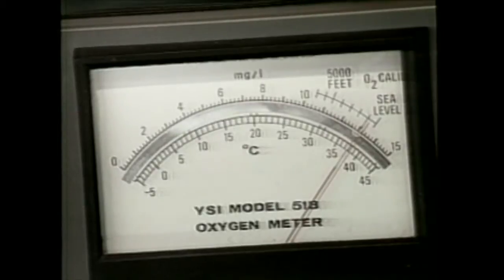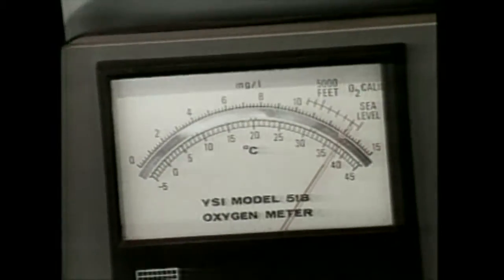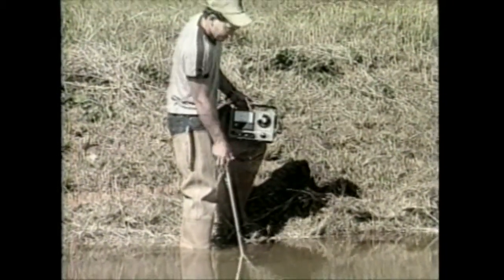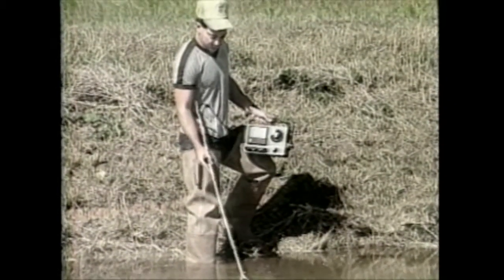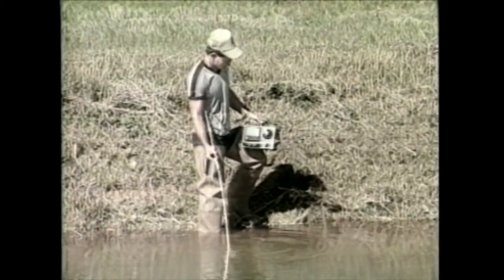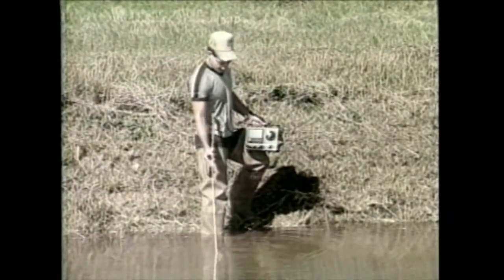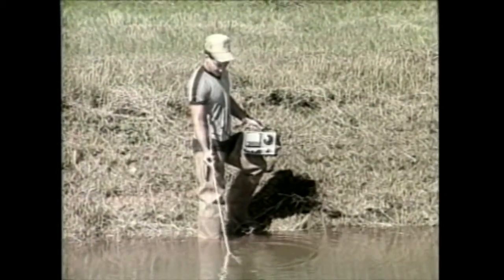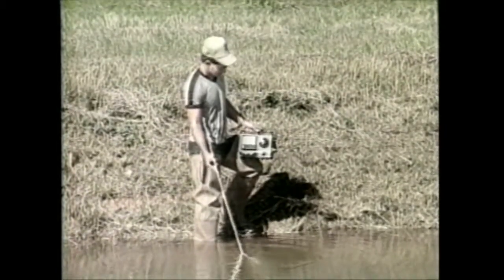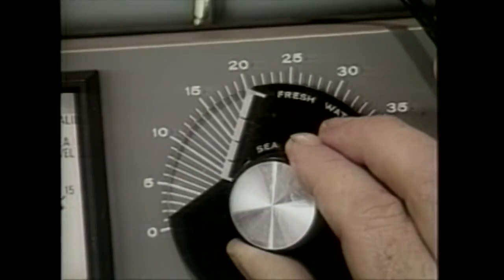The operation of each meter will be discussed separately. If your meter has a calibration scale located above the oxygen and temperature scales, switch the meter to the calibration position and adjust the knob so that the needle indicates the local altitude in feet. Allow time for the needle to drift, then readjust until a stable reading is obtained. Once the calibration reading is stable, switch the meter to the temperature position. The temperature of the pond water is then taken by placing the probe in the water and moving it back and forth. It is desirable to take the temperature reading where the oxygen reading will be taken. Be sure the reading is taken away from the pond bank, incoming water, aerators, and if possible with the wind at your back. Submerge the probe about one foot below the surface. Once a stable temperature reading is obtained, rotate the large dial on the meter to the correct temperature.